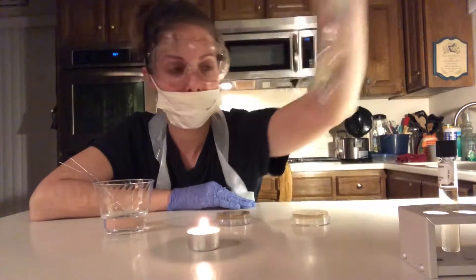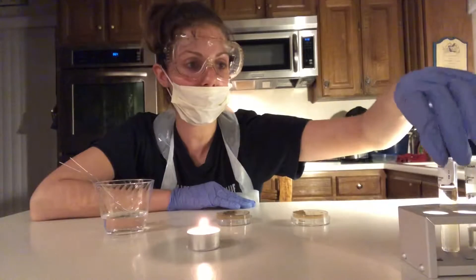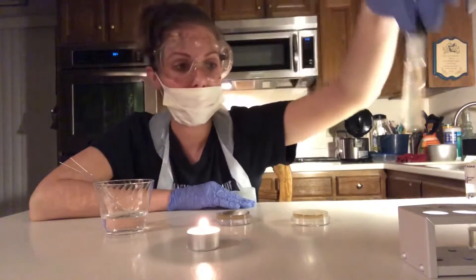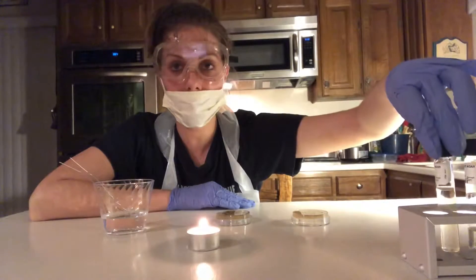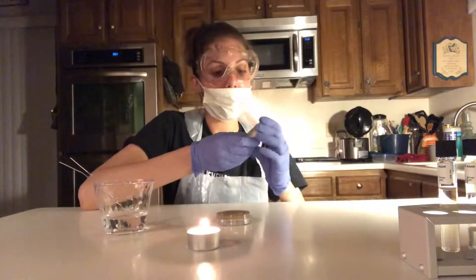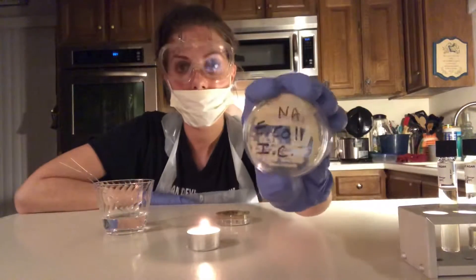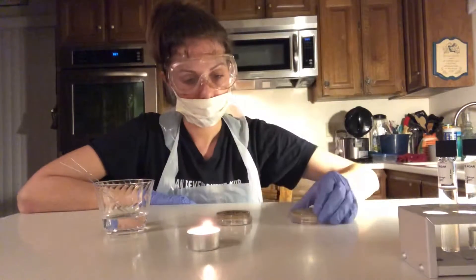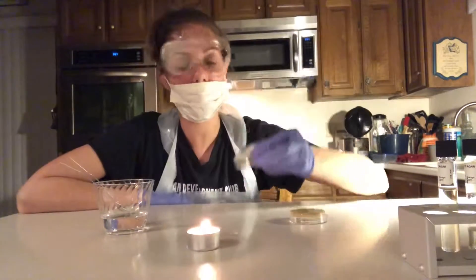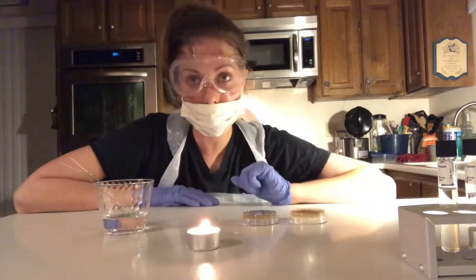The one I have labeled S. epidermidis — I'm basically going to transfer microbes into these two tubes using the E. coli agar plates and one for S. epidermidis agar plates that I prepped in a previous experiment.